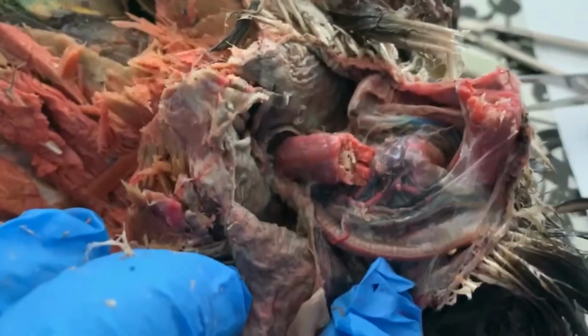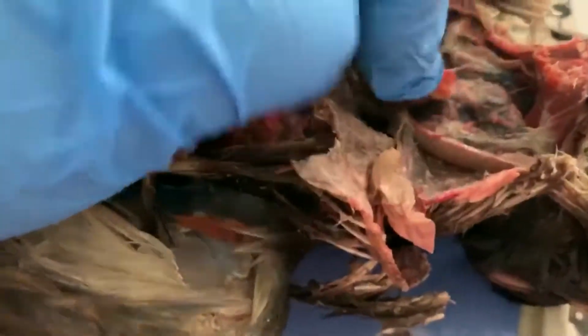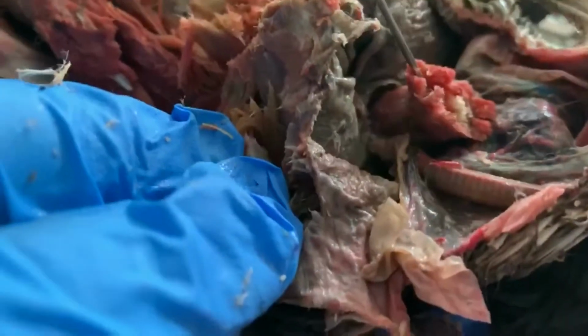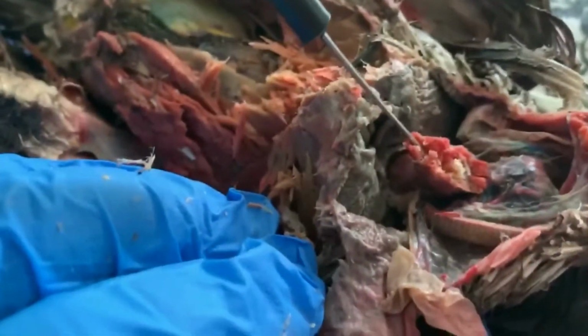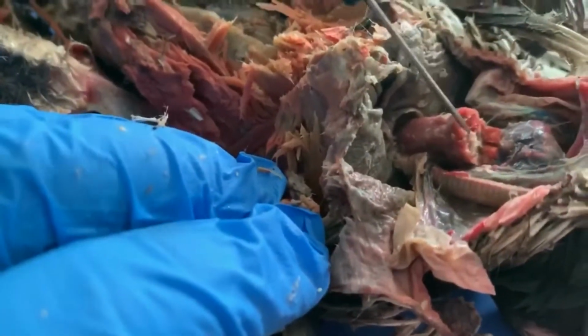We have two other structures. I've taken out part of this trachea. Now you can really look at it well and see, not with my gloves because my gloves are too big, but Ava's going to pull that piece back. You can see that bony structure that preserves the trachea. So the pink on the outside is the muscle, but then touch that bony structure inside. All right, this is why you cannot collapse birds' tracheas.